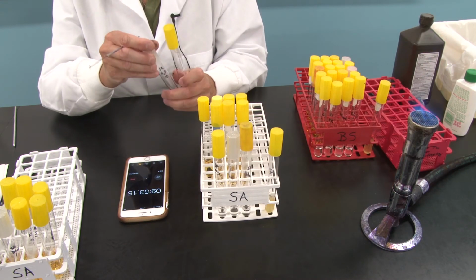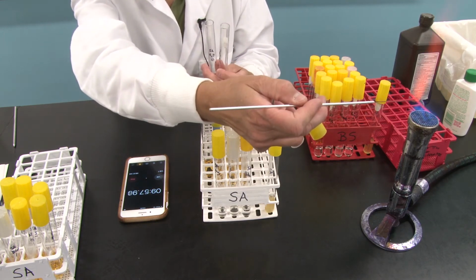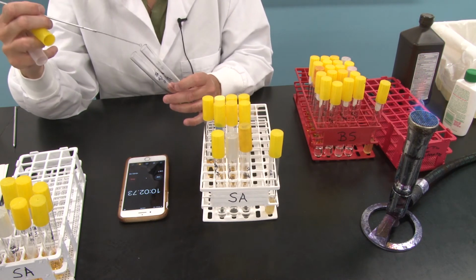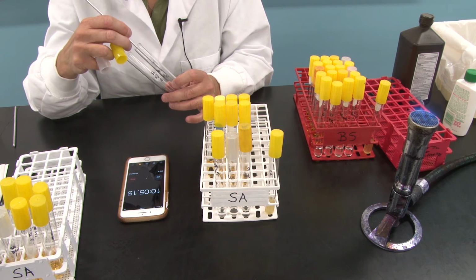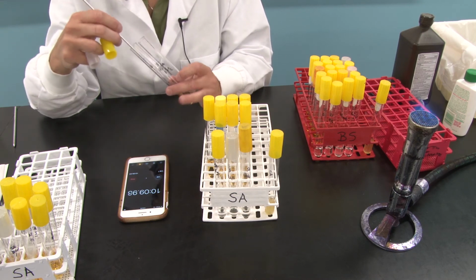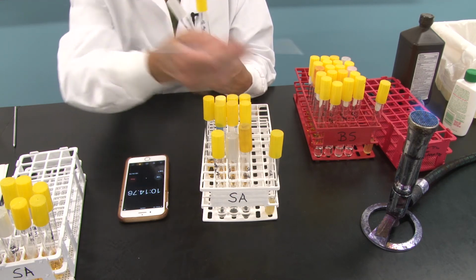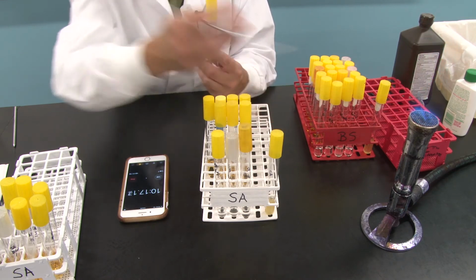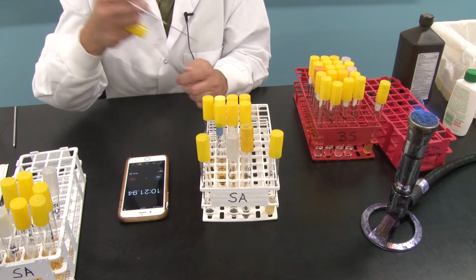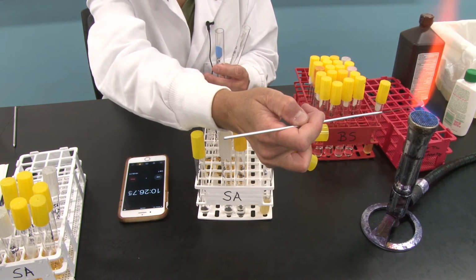Okay, we're back, and here we go again. We've got SA hydrogen peroxide, and we've got SA hydrogen peroxide, the 10-minute tube. I flame my loop. I go into the hydrogen peroxide where now the bacterial cells have been exposed for 10 minutes, and I transfer a loopful to the 10-minute tube, put my caps back on, flame my loop, put this aside, and grab the hand sanitizer along with the hand sanitizer 10-minute tube. And you know the routine now.